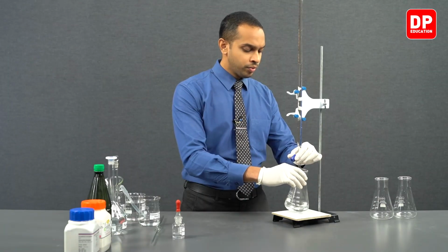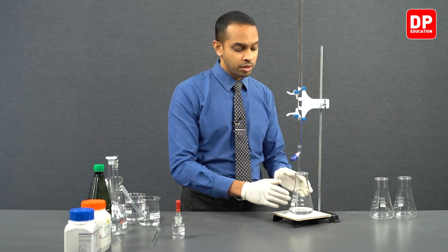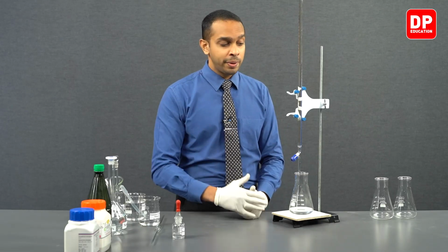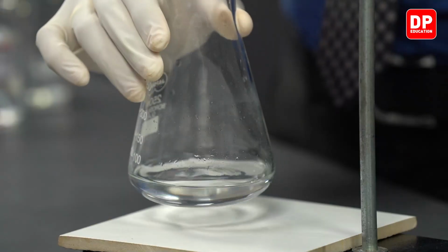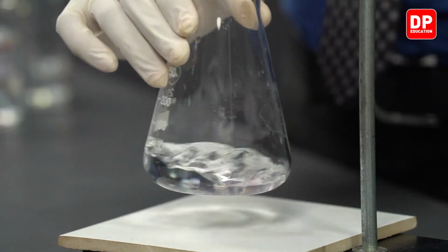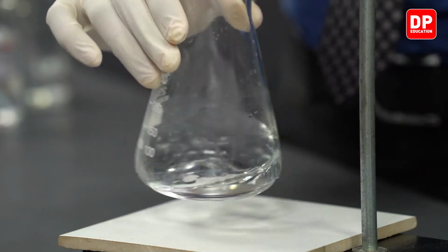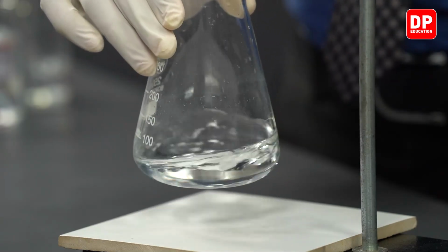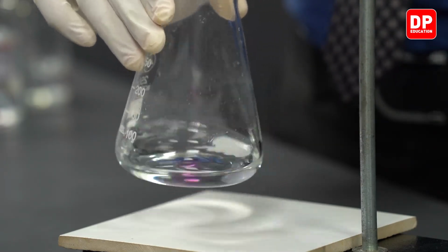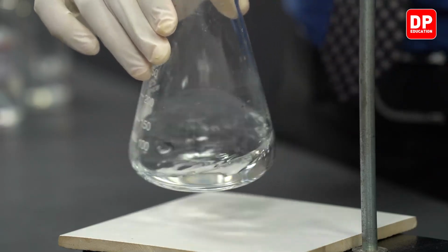You can see the sodium hydroxide drops when they come into contact with the solution. Now the pink color that is formed is a bit more persistent than it was before, indicating that there aren't many acid molecules remaining in the medium. So now you can start adding sodium hydroxide drop by drop to get to the correct endpoint.